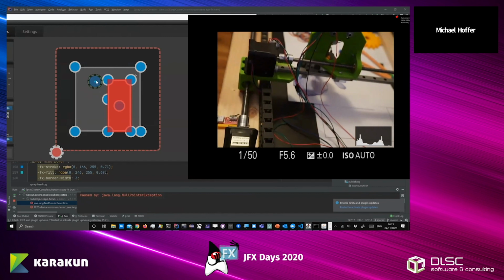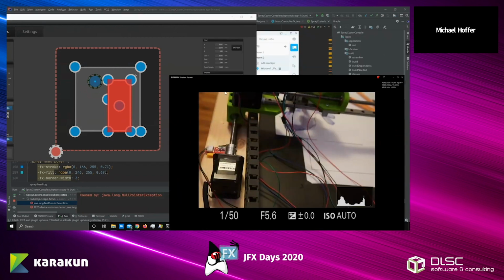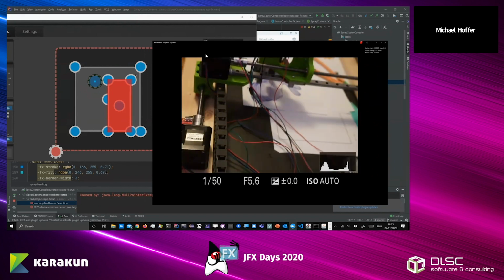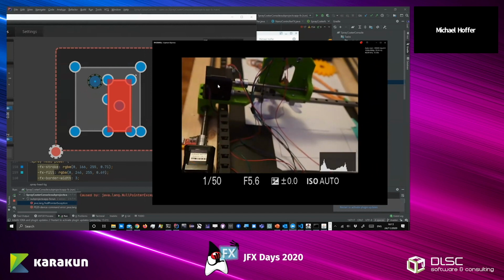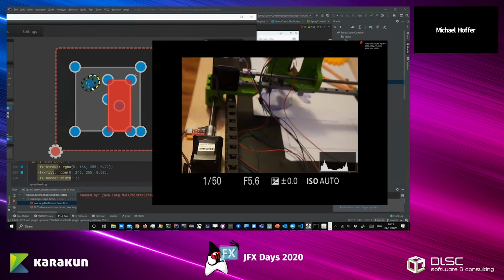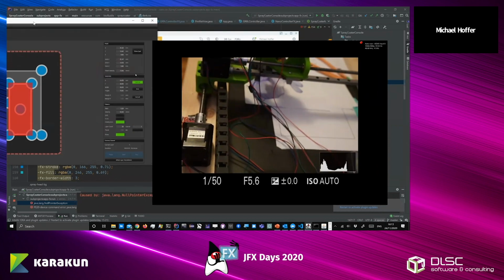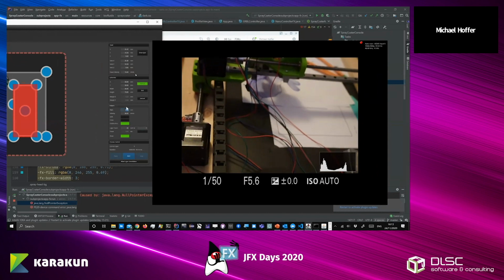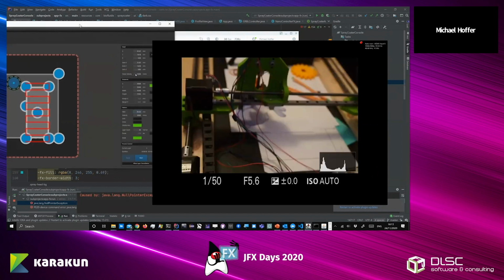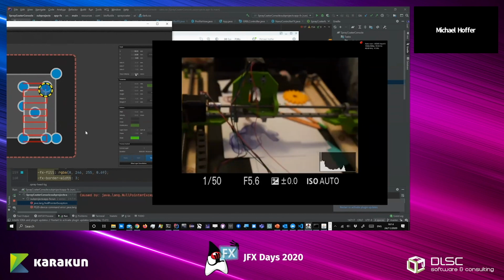And this is just done with JavaFX properties. So we create device objects that encapsulate all the hardware access and provide JavaFX properties for them, and they are then just translated. So the events are directly sent to the hardware from JavaFX. Okay. And if I would start the process, let's change the pitch, something like 10. I could start a process. And that's what the machine would do.